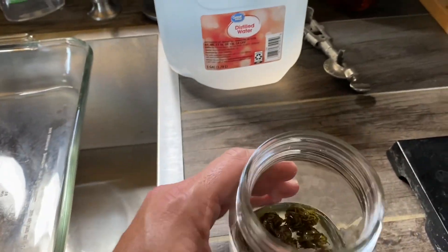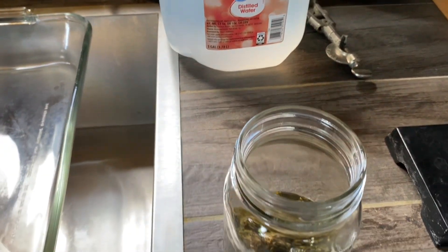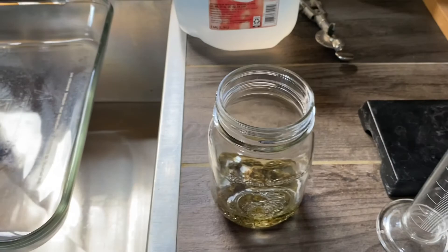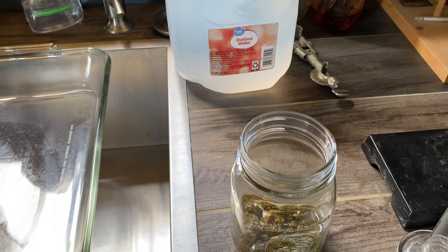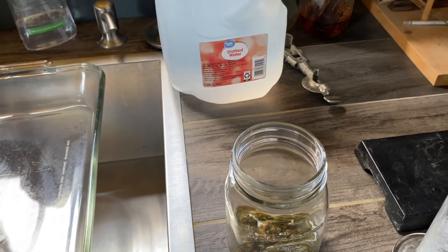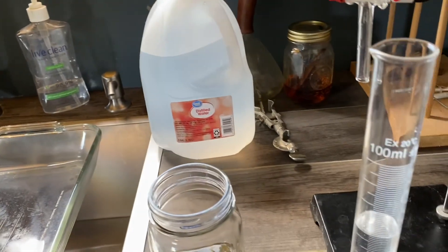So there's 100. I would say maybe 150 milliliters, and we have 200 milliliters of distilled chilled water here. And while we're doing this, we can go ahead and get a temperature. About 160.